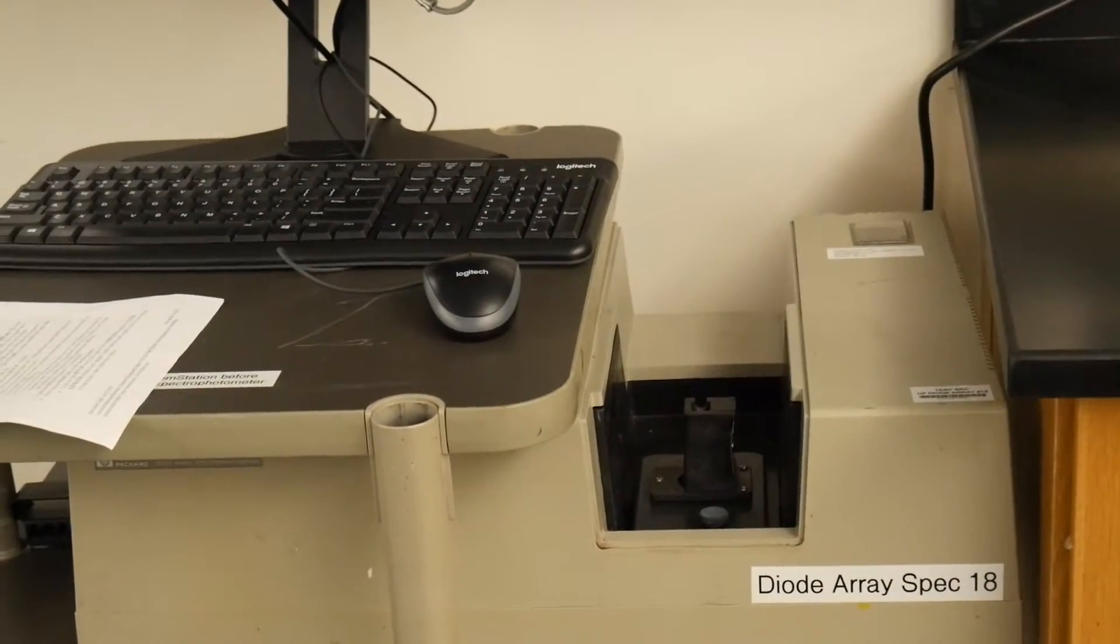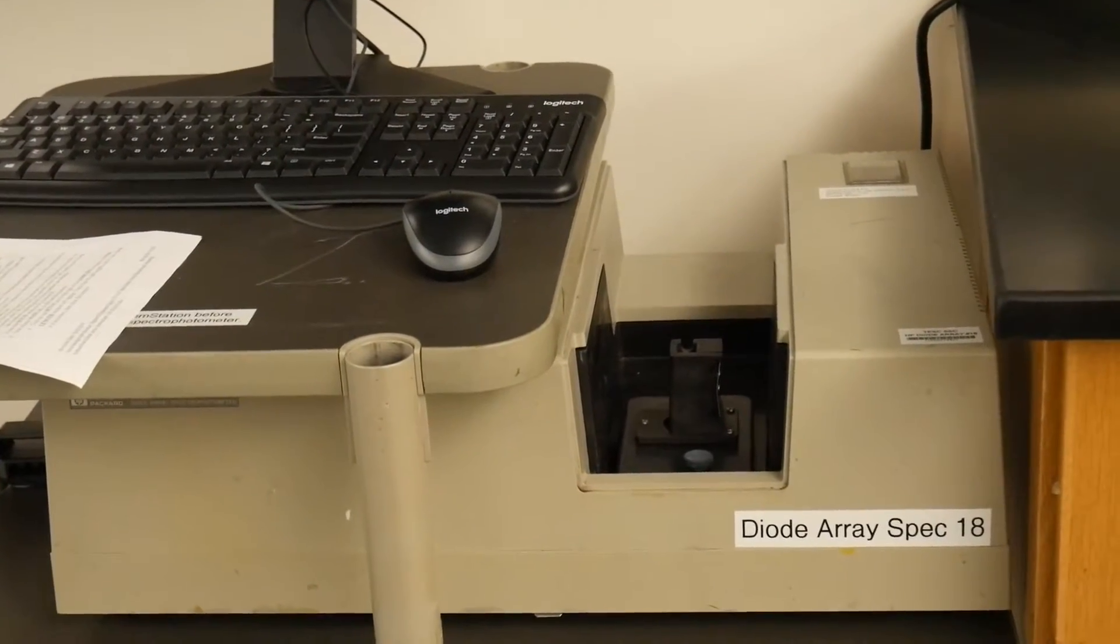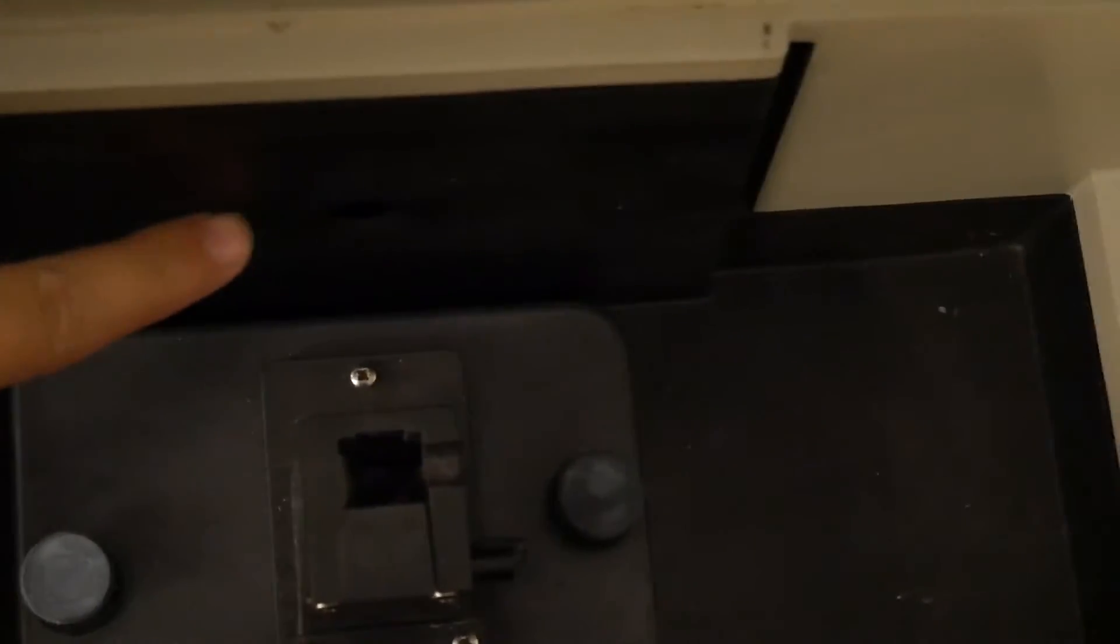So here we have one of our older UV-Vis spectrophotometers. So if you look at the cuvette holder here, you will see that the light is not running front to back as it was in the previous UV-Vis. If you look right here and I get on the other side, you will see where the light passes through. So in this particular case, the light is going through this way. So you always have to be very careful that you align your cuvette with the light path.